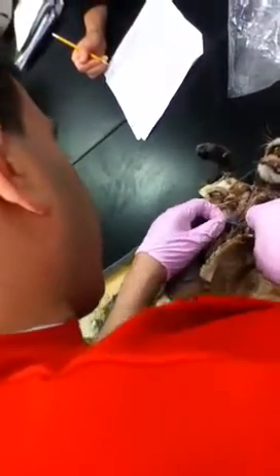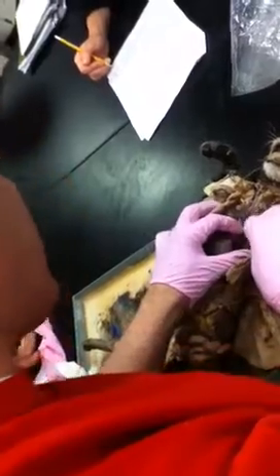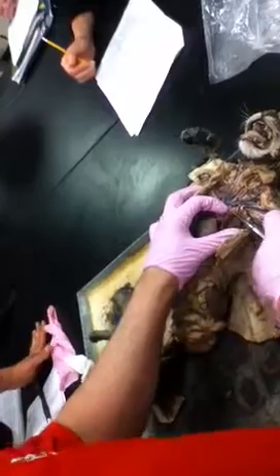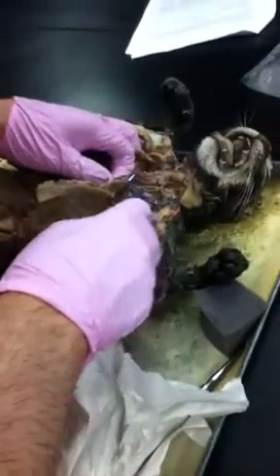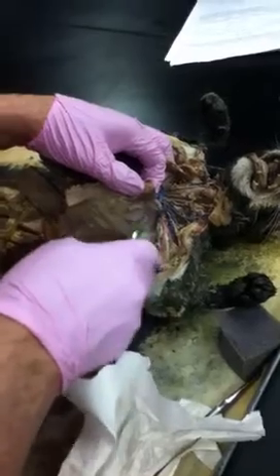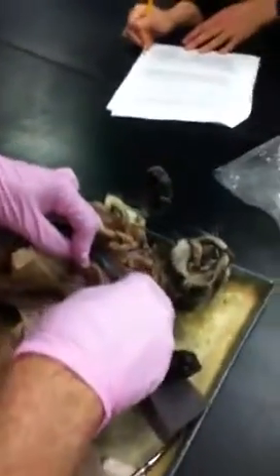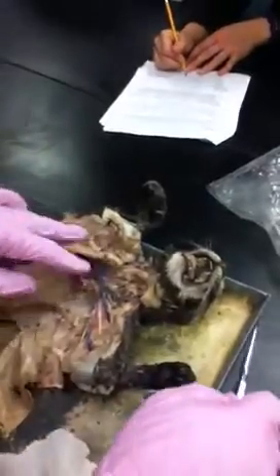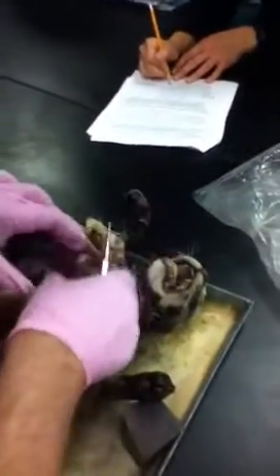And then the other branch off of here is going to be the left subclavian, correct? So we got the left subclavian, and then inside of that, and that would be more of a picture thing, inside the rib cage it's subclavian, outside would be axillary. Then we've got our subscapular coming off of the subclavian, axillary into brachial. Pretty good. And everything's pretty clear on here.